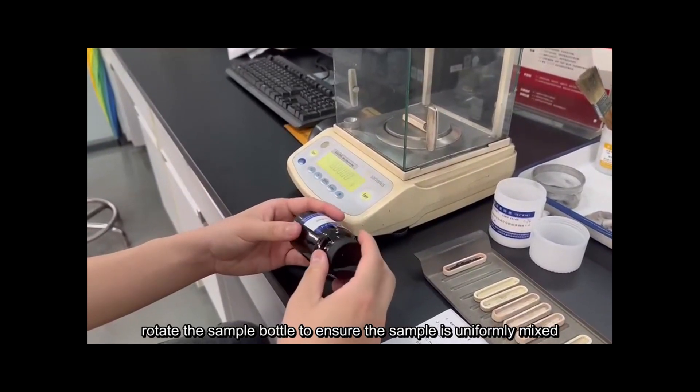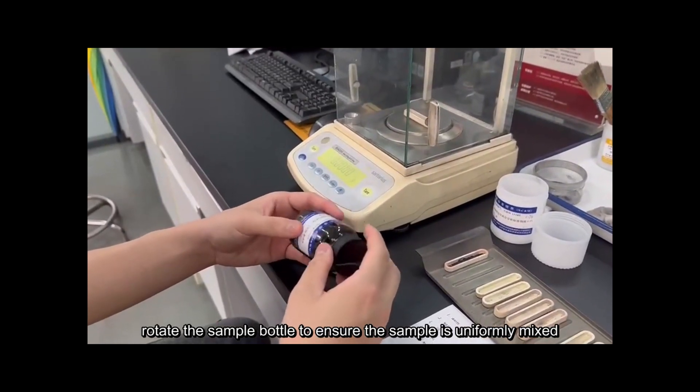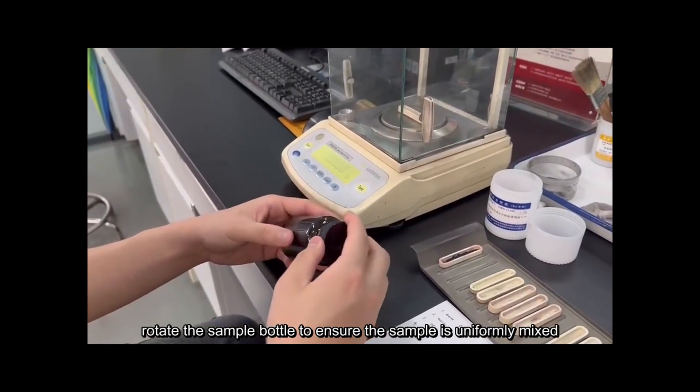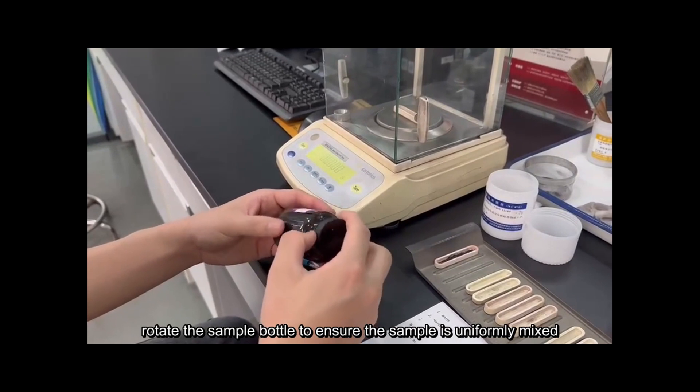Rotate the sample container to ensure the sample is uniformly mixed.